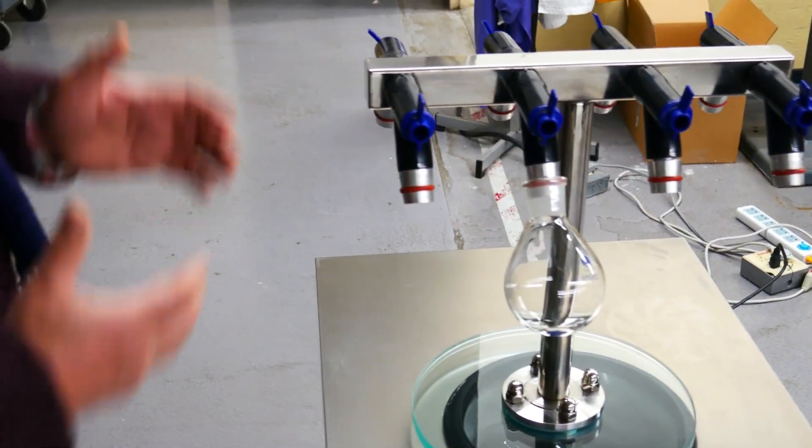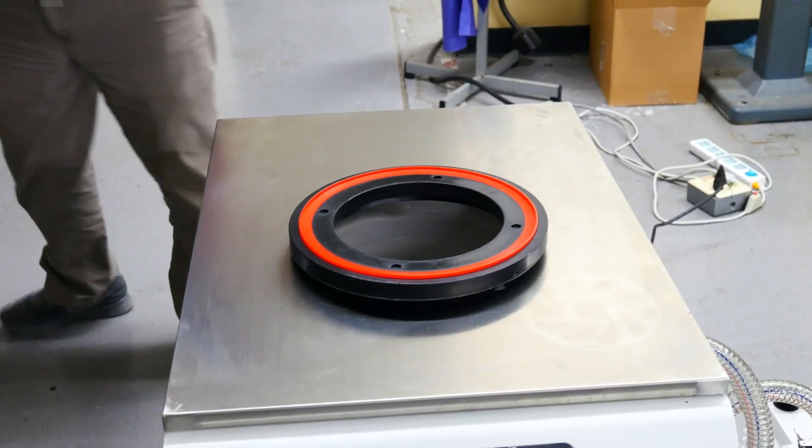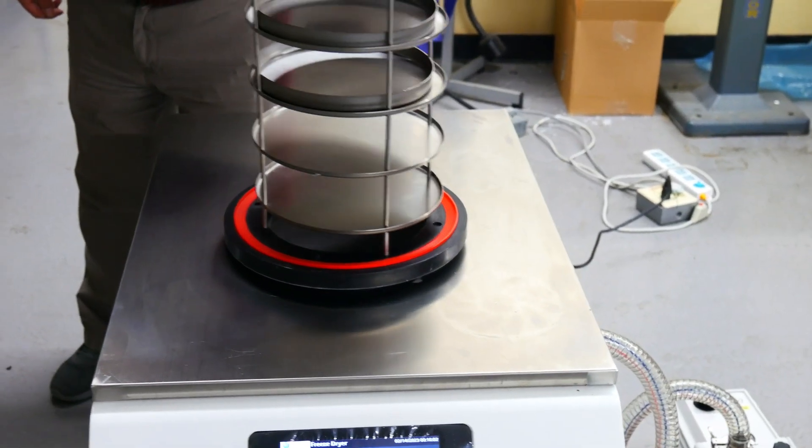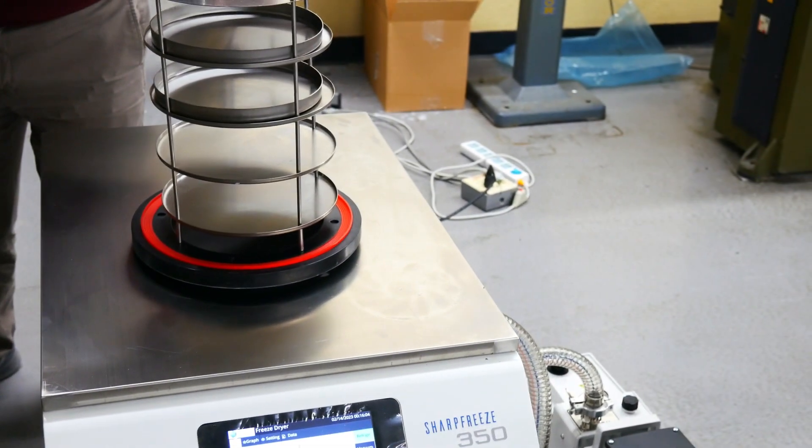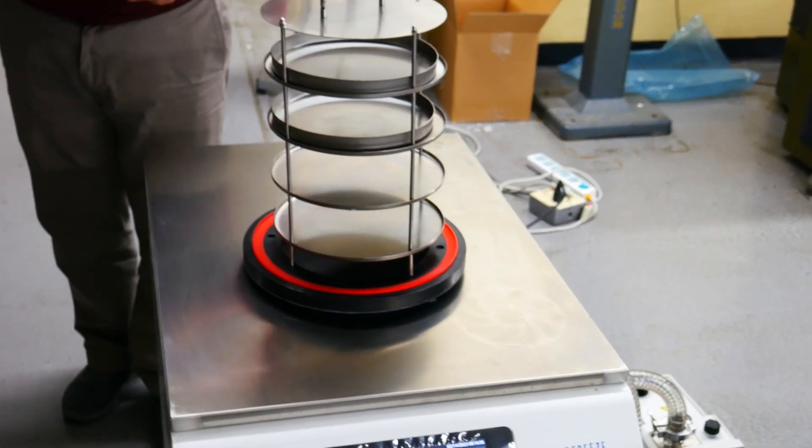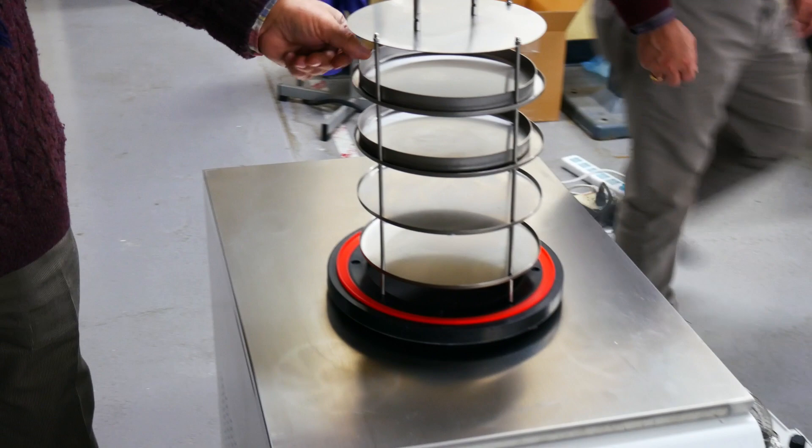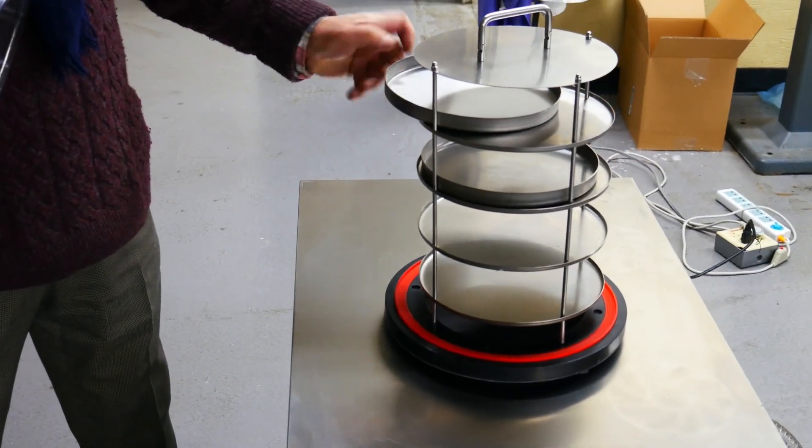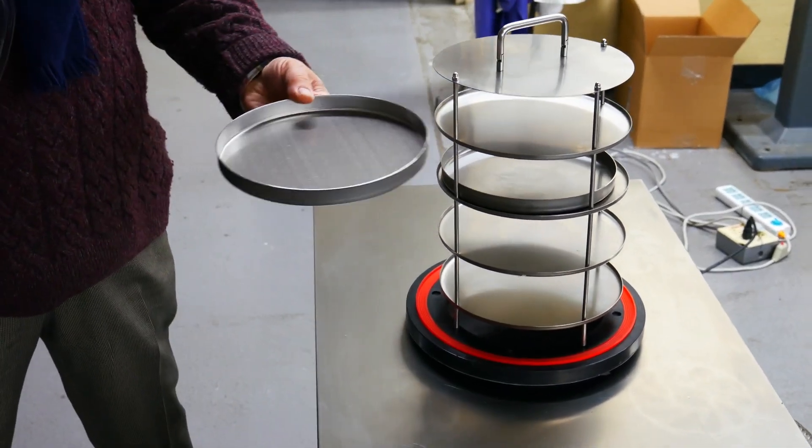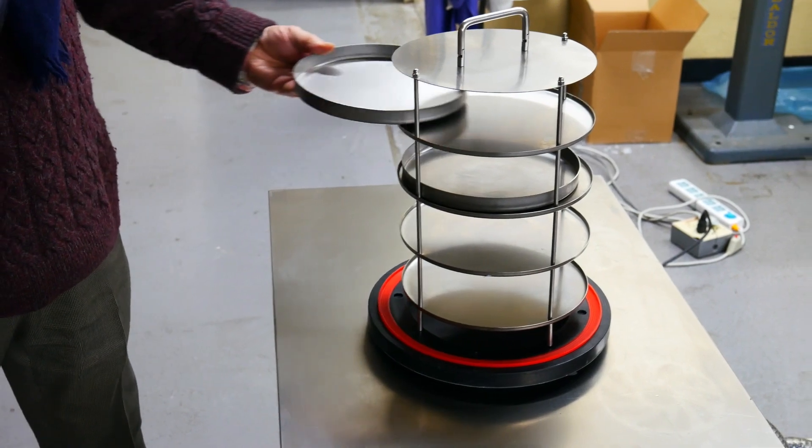There is another feature which adds to the SharpFreeze's flexibility. You can do this, which provides you with a tray, place a 10 or 15 inch manifold cover on it, and you can place samples on the trays. You can also place vials and flasks on the trays, so you have the most flexible system for freeze drying in the market.